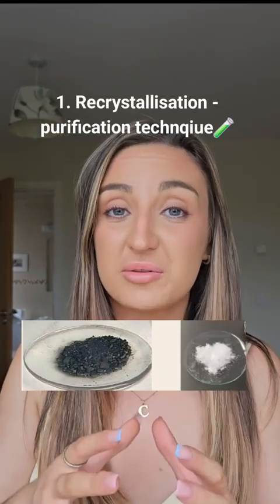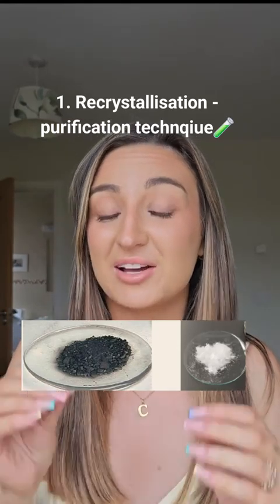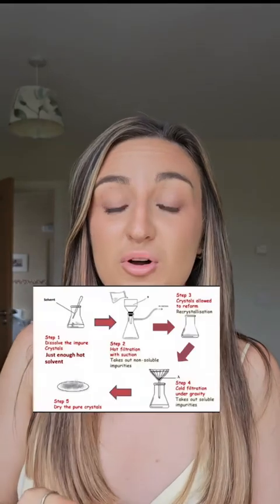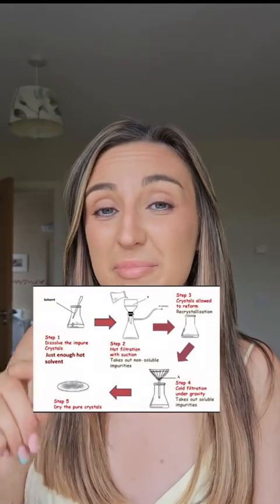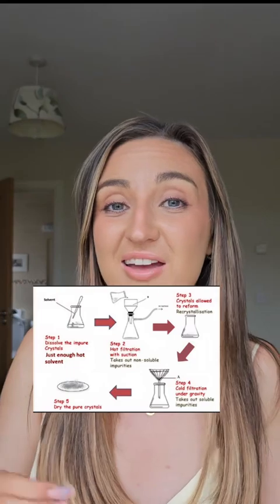What we're trying to do here is we're trying to separate the impurities from the benzoic acid based on their solubility. Because our impurities like charcoal are going to be insoluble, we're going to be able to filter them out. Step 1, we're going to dissolve this whole mixture in a minimal amount of hot water. This is going to create what's called a saturated solution. And this is going to ensure that we have a really high yield of benzoic acid. In other words, we're going to isolate as much benzoic acid as we possibly can.